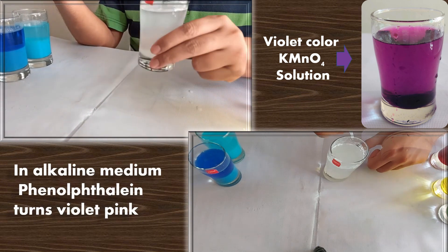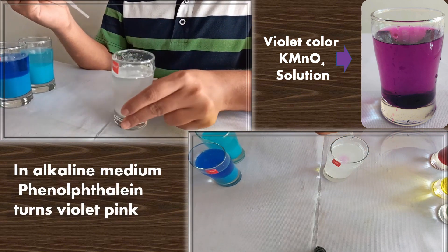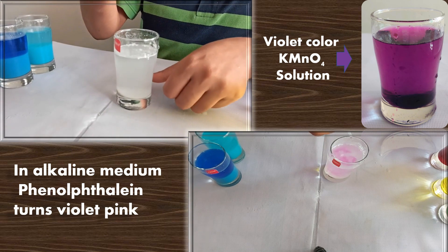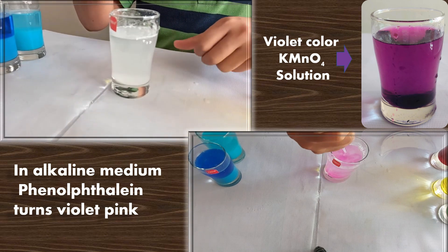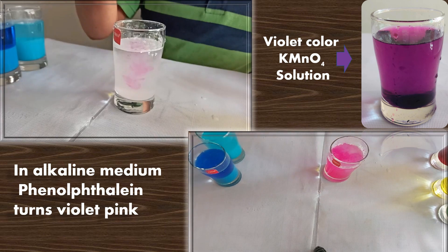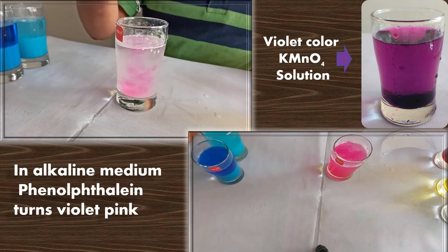Now we will turn this white color phenolphthalein solution to violet color by mixing base. Let's see — wow, you see a very nice color is coming.